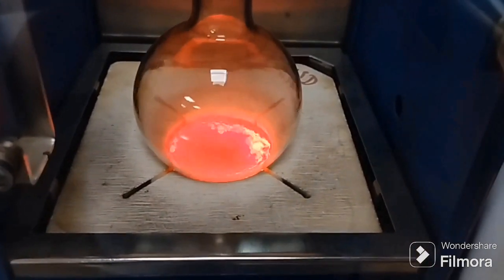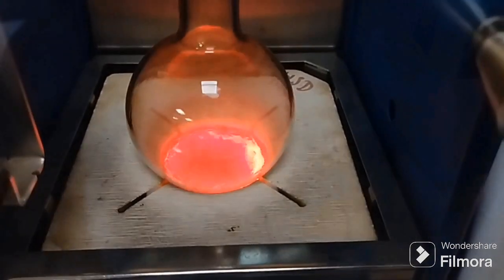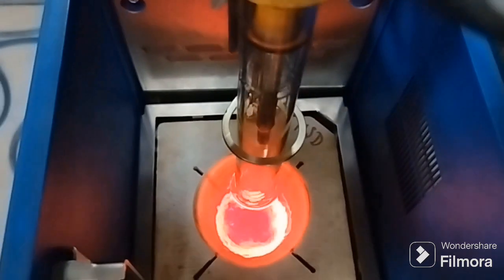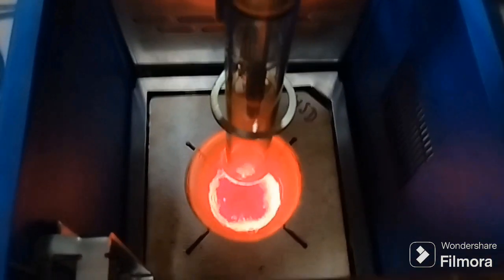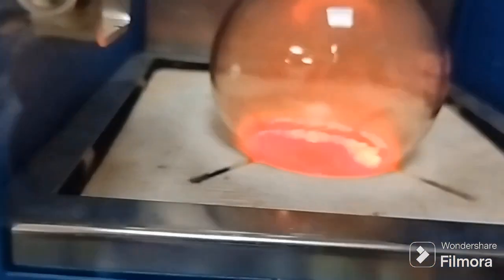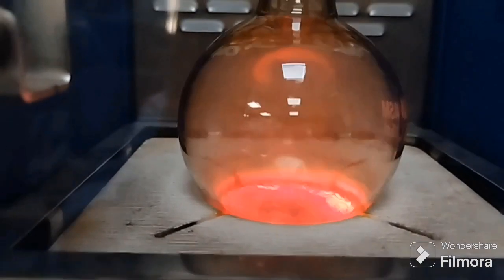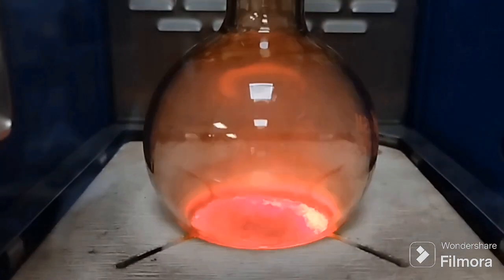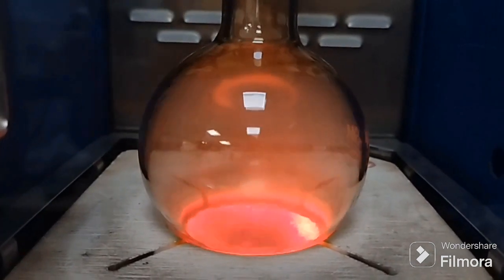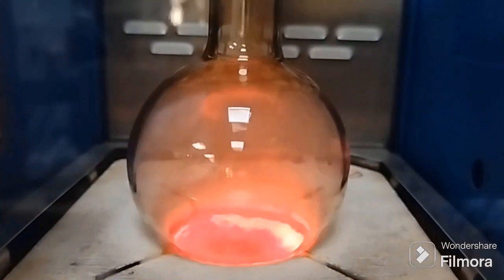Now you can see how it's going. This is the actual last phase. You can see that a very little amount of this petroleum sample is left here, and it's red hot. That red hot is actually the heater, because it's at such a high temperature that it makes everything look reddish, right? Now whatever is left of that sample is going to convert into vapor form, and a whitish vapor is going to form in the distillation flask. It's under process.